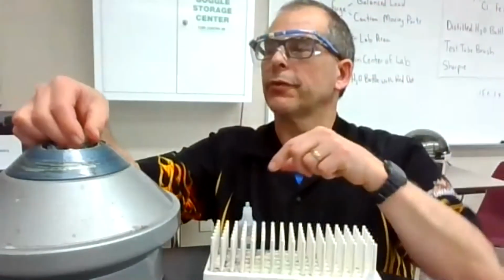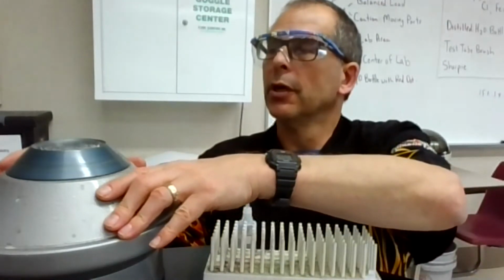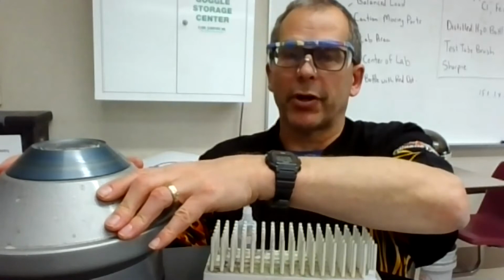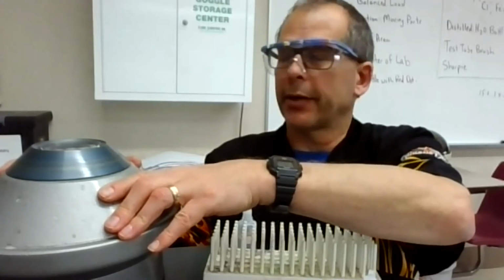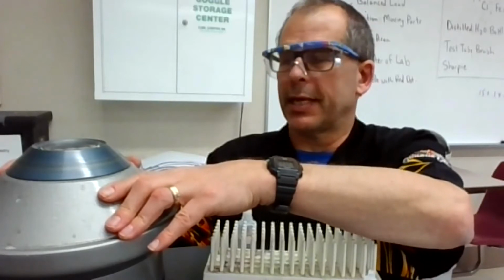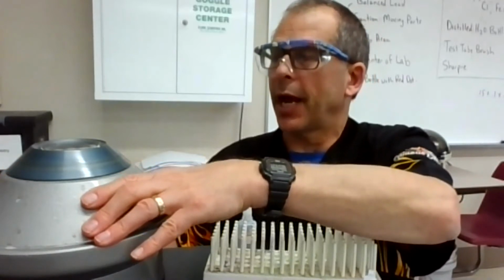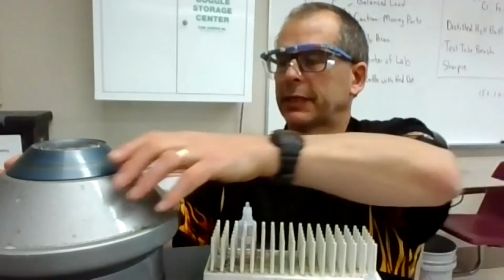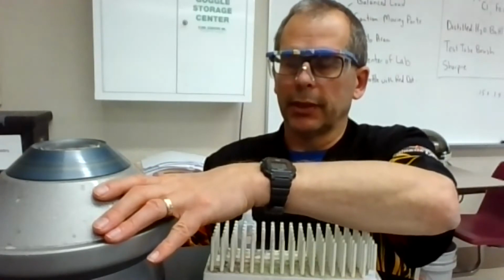Okay, I'm going to put this in a centrifuge. I'm putting it across from each other, and then I'm going to spin that around. So centrifuge, what it does is it spins around really fast, and heavier objects go to the outside more readily than lighter objects. So when you go on a spinning ride at Valley Fair, you get essentially forced to the outside of whatever the spinning thing is that you have. So I'm going to spin that around real good, and hopefully I mixed it well, and I hope that separates it. Sometimes these can be a little fussy, so we're going to see what happens with it. Let's go just a little bit more.